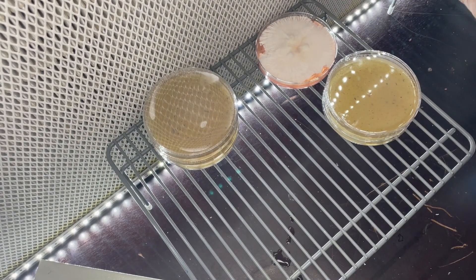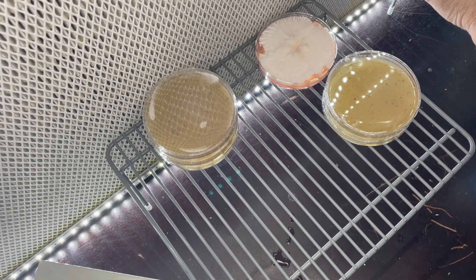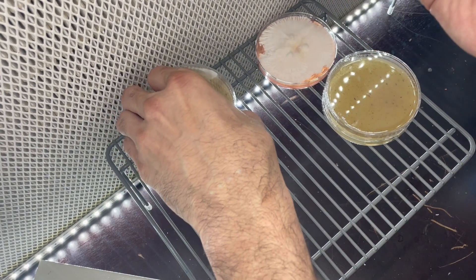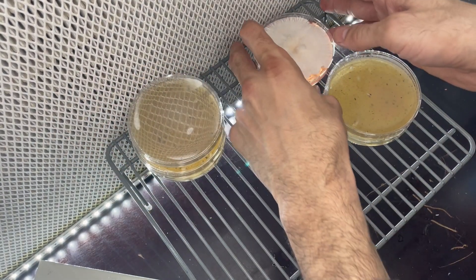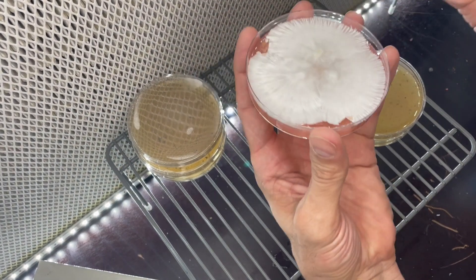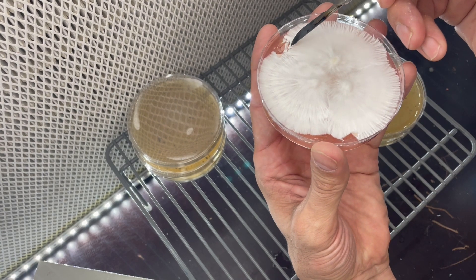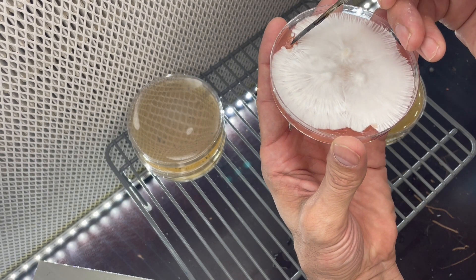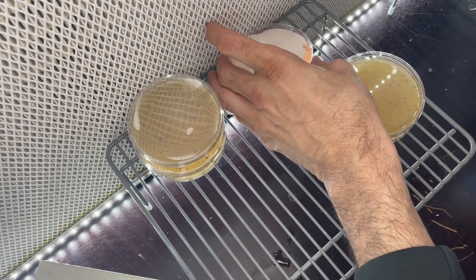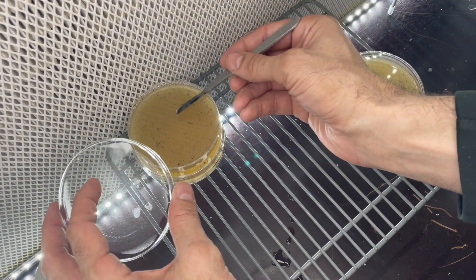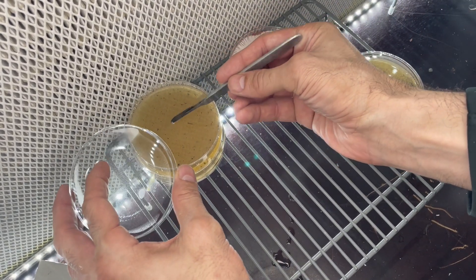Move this cover. I like to keep everything as close to the front of the flow hood as possible when you're doing work like this. You don't have to sterilize your blade each and every time. In different scenarios you may have to sterilize more, but during transfers you should be good to go.